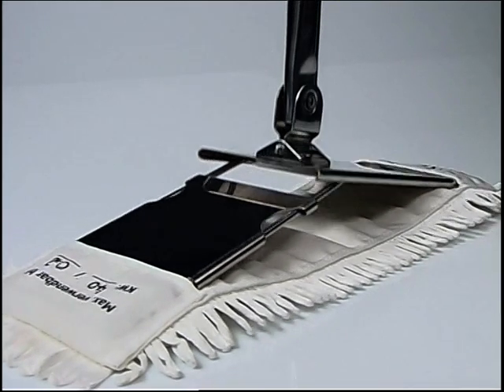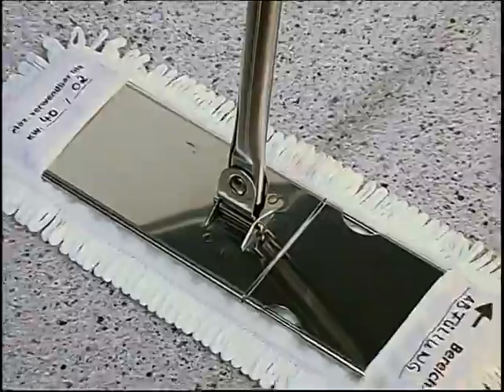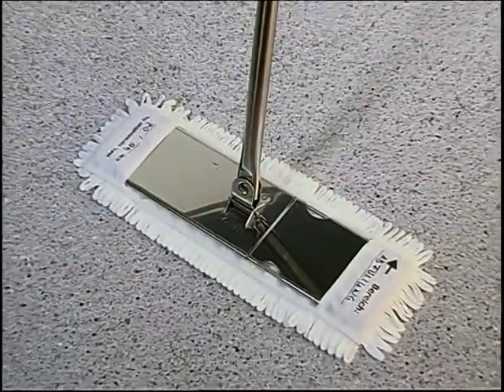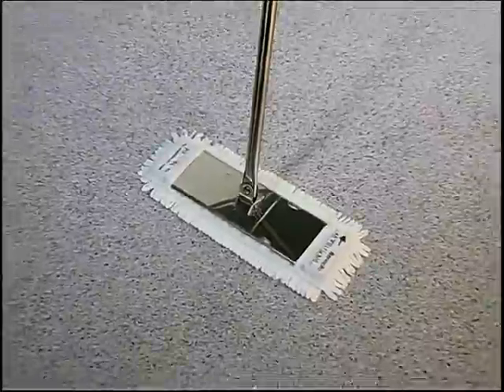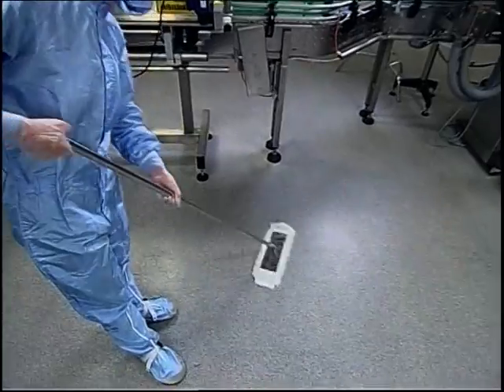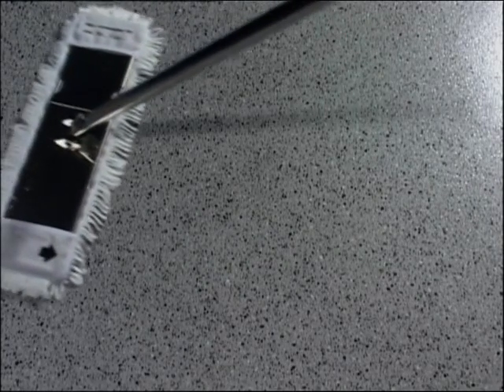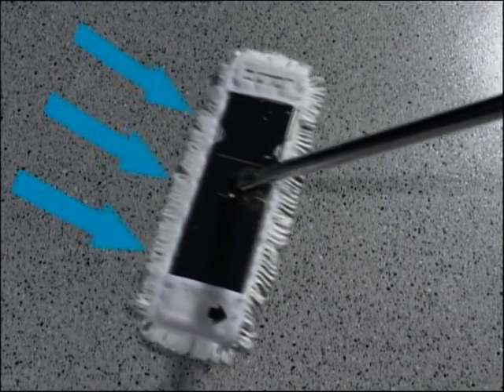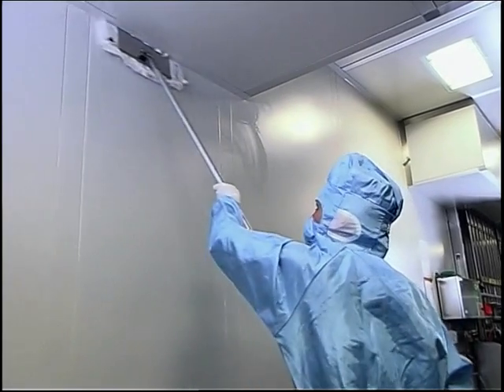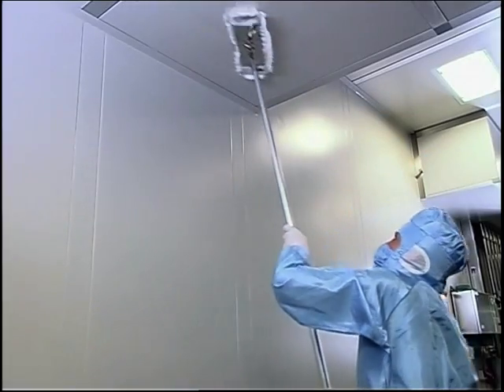The mop cover itself can be fitted hands-free using the special folding mechanism. It is very simple. All in all, the handling and the area covered by the mop have been considerably improved through the greater width of the mop head, the new mop material and the mop joint, which makes it particularly easy to guide. Of course, it's also far more economical. And there's another special advantage. That is the even application of the disinfection solution from the mop. The surfaces are covered with a uniform film of the solution. Not too much, not too little. The same goes for cleaning the walls and ceilings.